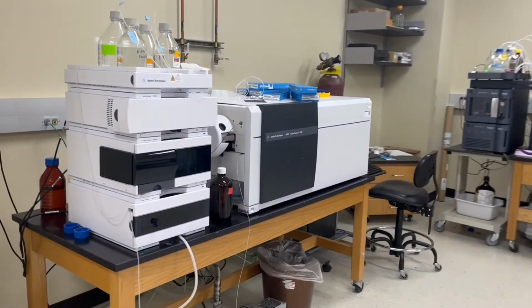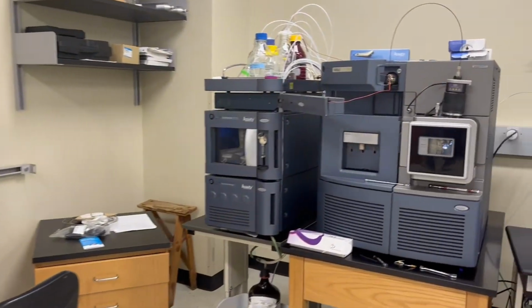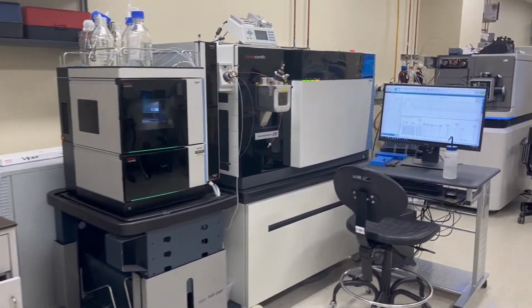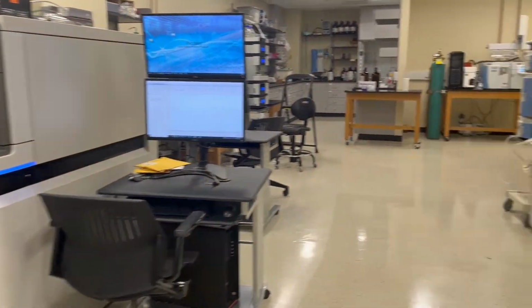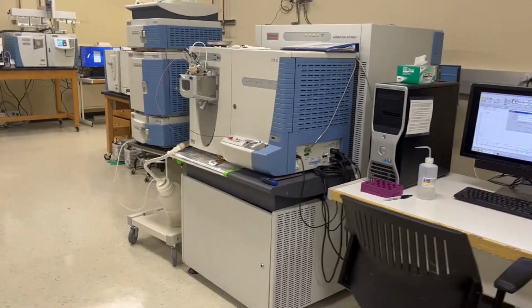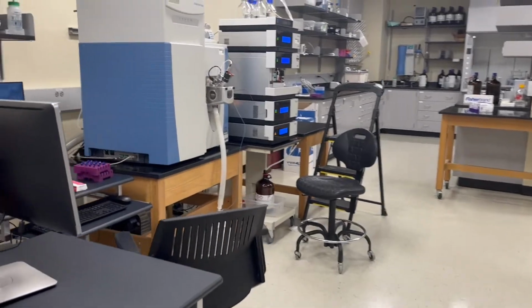The Baylor University Mass Spectrometry Center is home to 8 different instruments and is growing with the Baylor research community. Unlike many mass spectrometry facilities at other universities, each of these instruments are available for students to use for their research projects after proper training. Commonly used instruments include the Thermo Orbitrap Fusion, Waters Synapt G2-S, and Thermo Orbitrap Discovery.